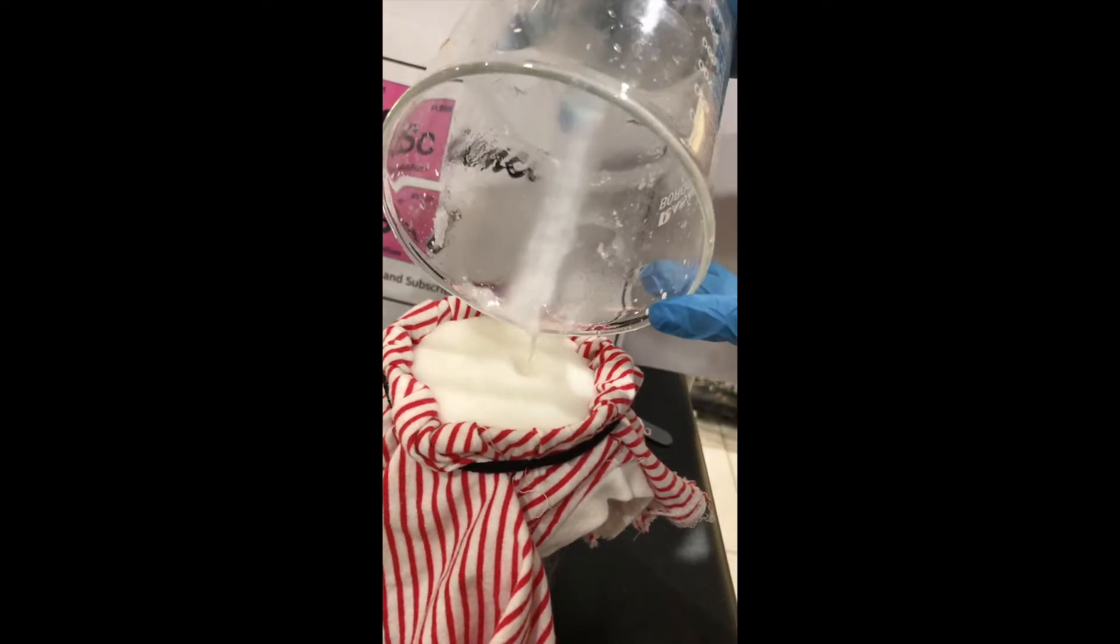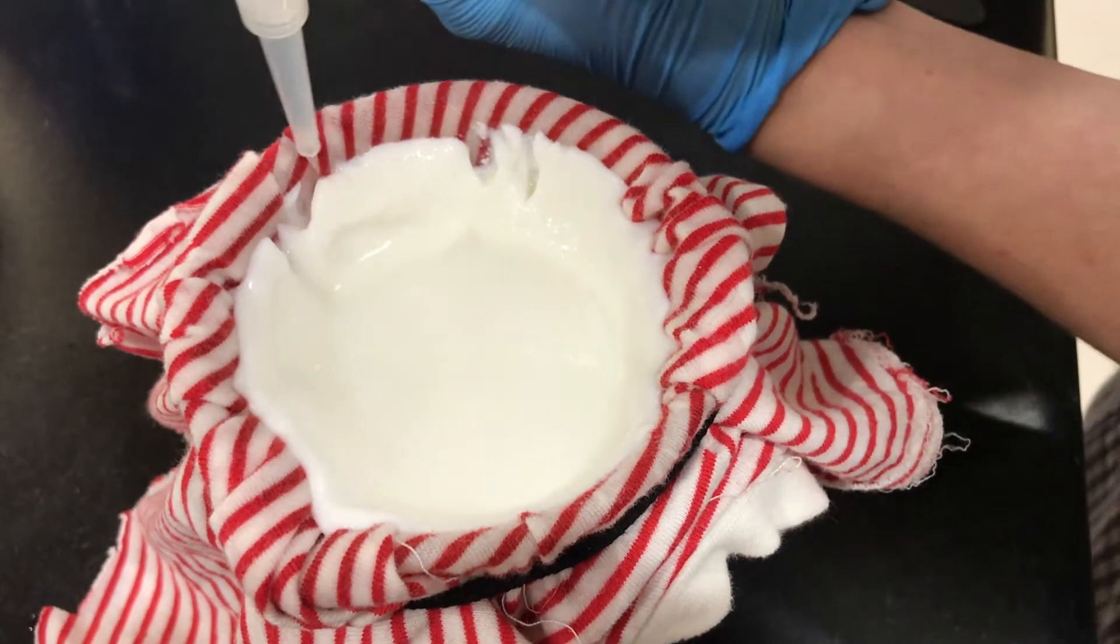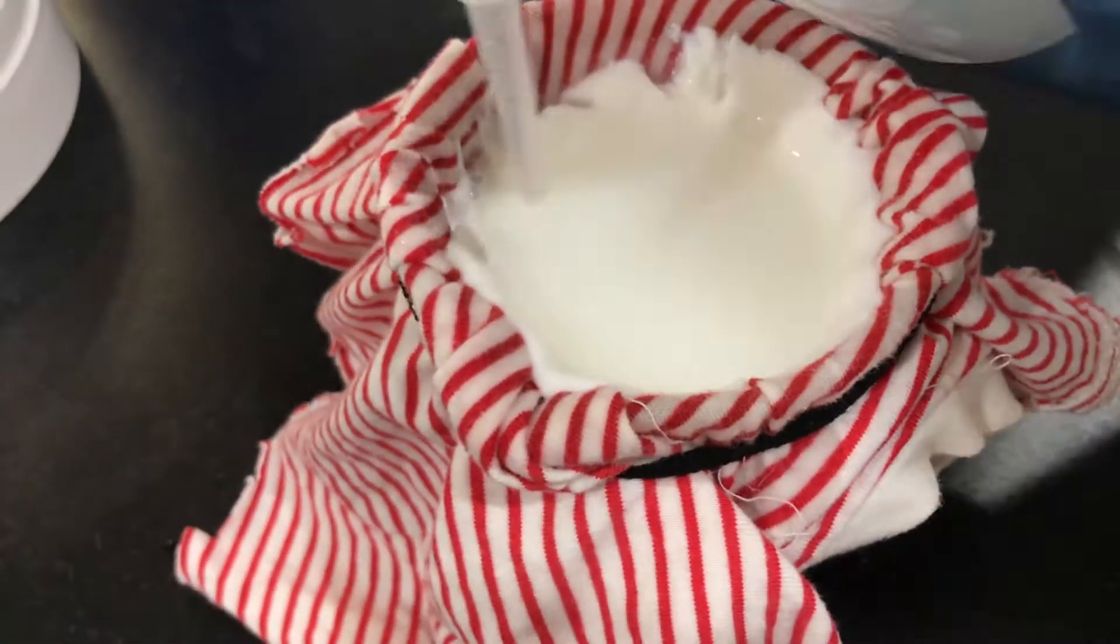This will also help to wash out the sodium acetate. I am now doing my final rinse by squirting water around the edges of the filter.